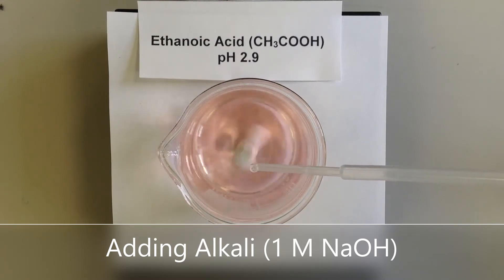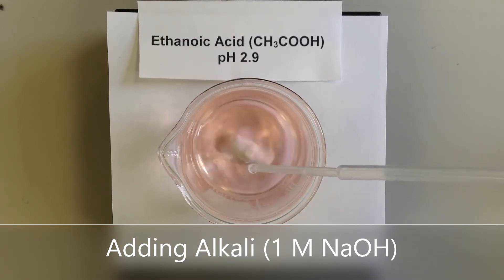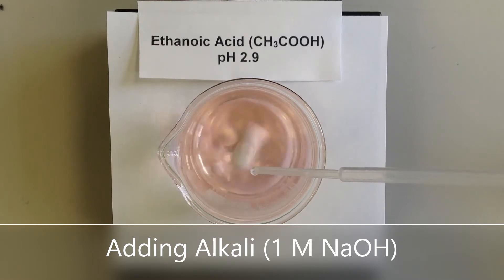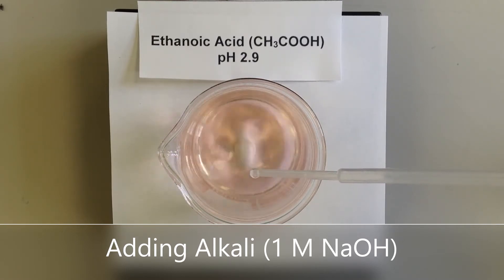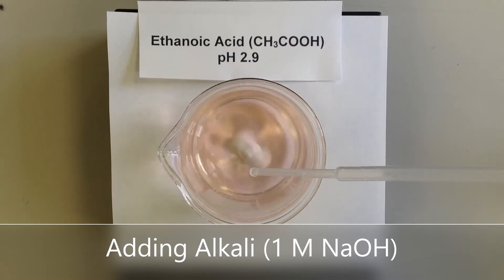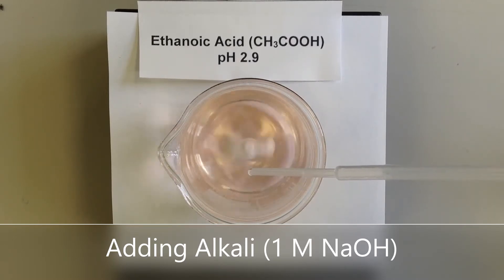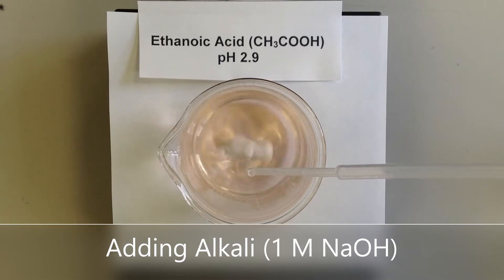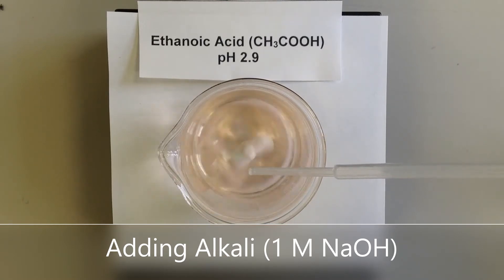Initially the pH is rising. It seems to be now fairly steady, and it's absorbing quite a lot of NaOH.